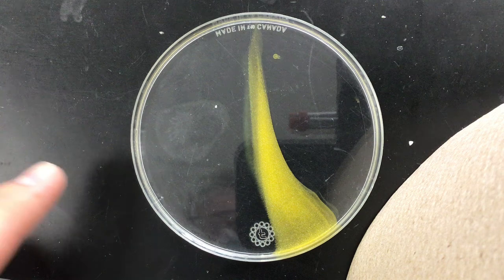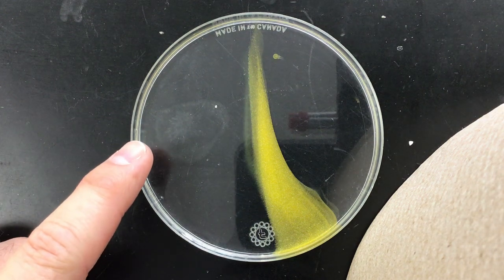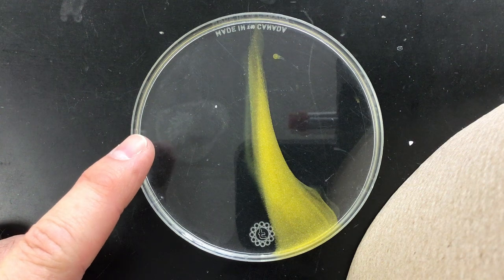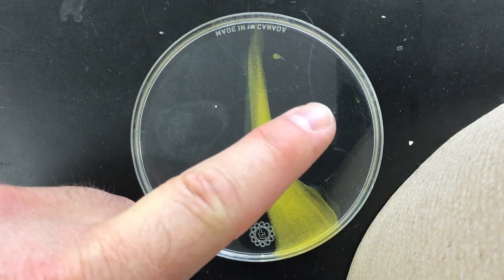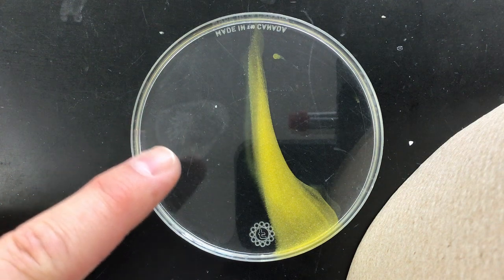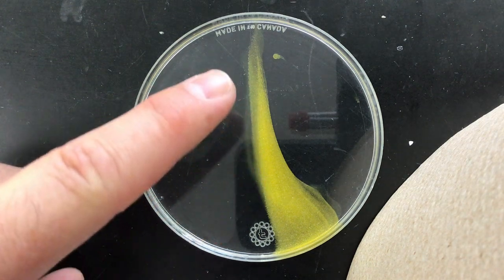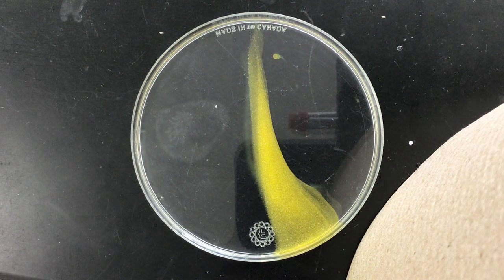It does look like — actually, I think that was there before. I don't think we made anything there, or if we did it's very very faint. So the potassium iodide over here — it looks like not a lot of it got through, or possibly all of it got used up here in the center.